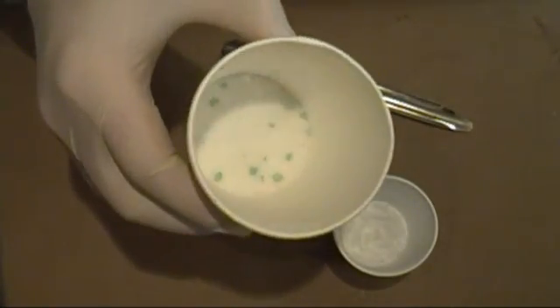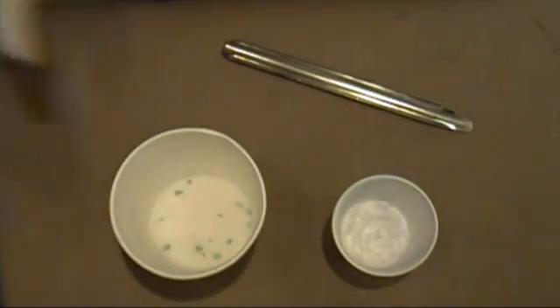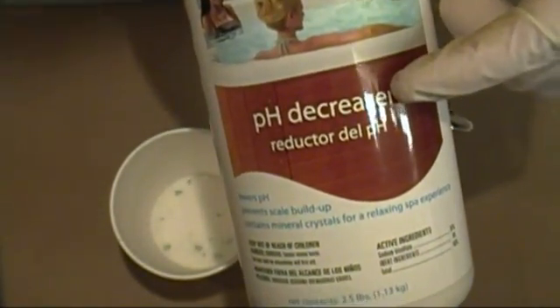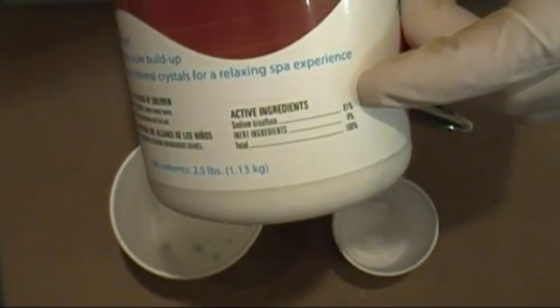To begin, weigh out about 100 grams of sodium hydrogen sulfate, also known as sodium bisulfate. I'm just using cheap pH decreaser used in pools, which is why it has all those small blue pellets in it. Not to worry, they don't affect the end product.